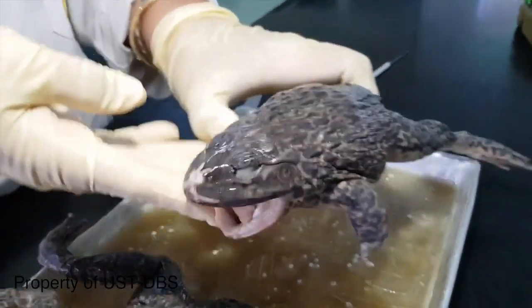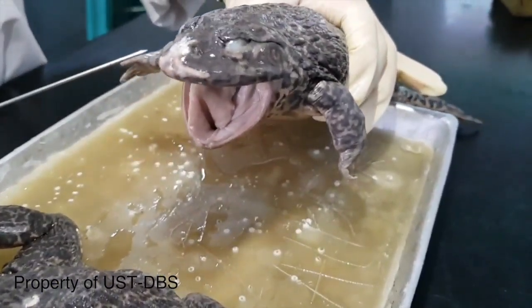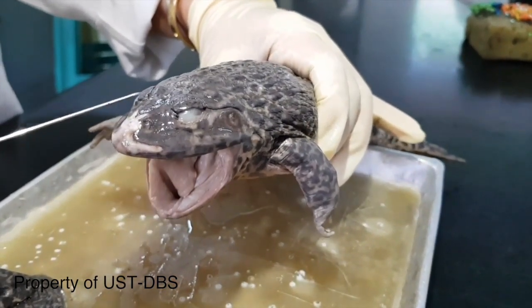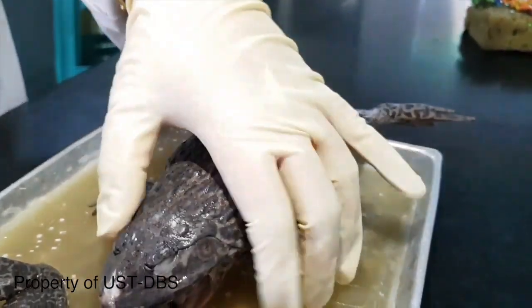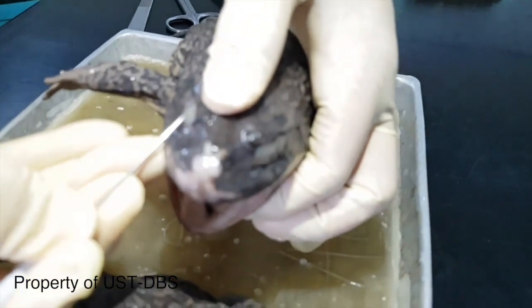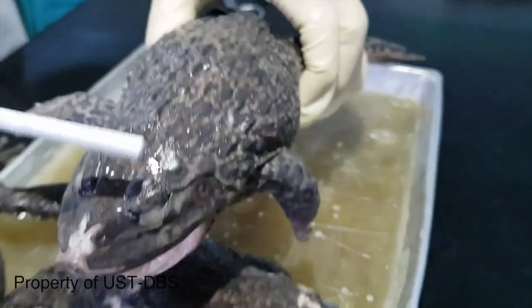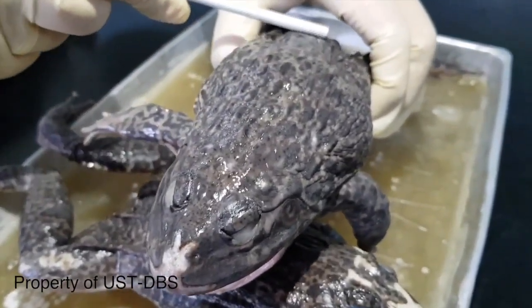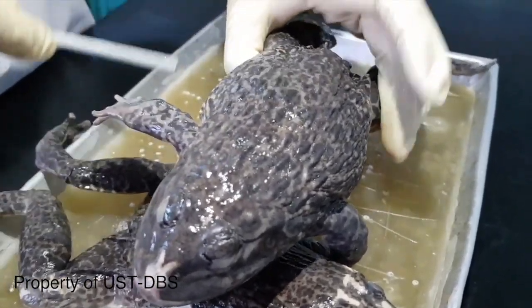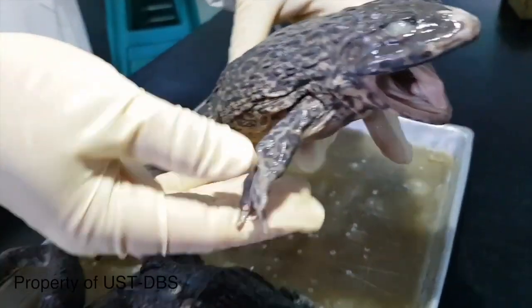So this one at the snout, you would see the presence of nostrils here and paired eyes with a transparent membrane that covers it. It's the nictitating membrane. And then as you go downward, going caudal, you see a hump that is present here, the sacral hump. And then you have the limbs that are present.